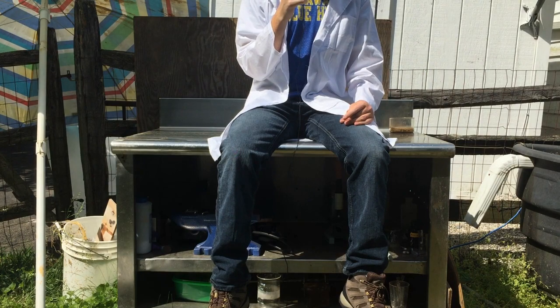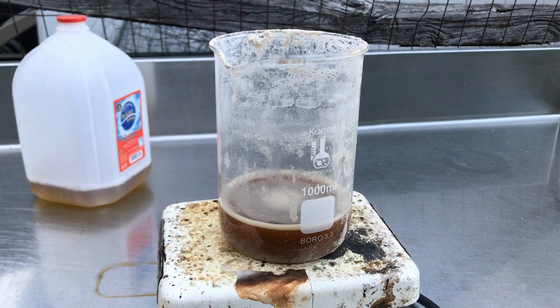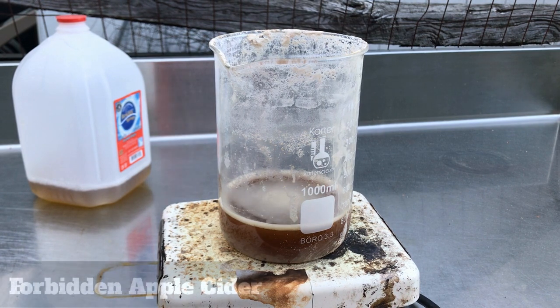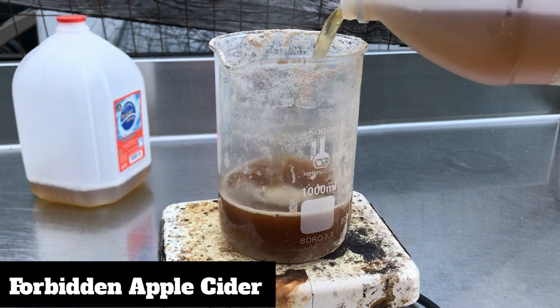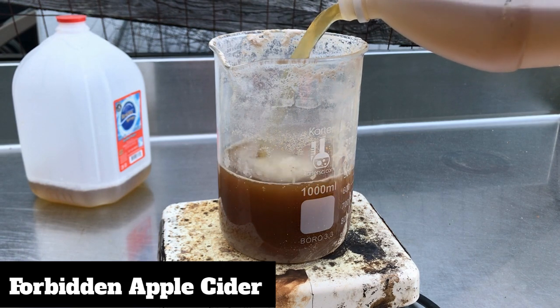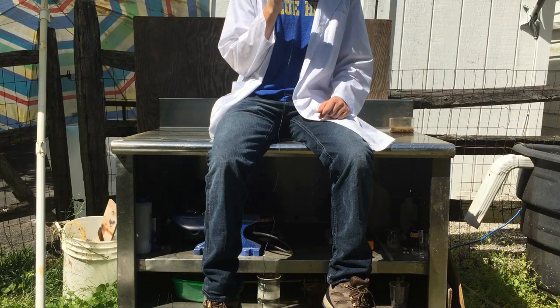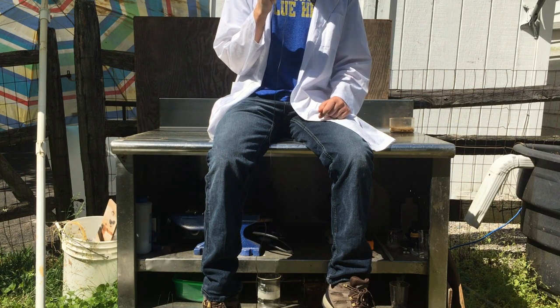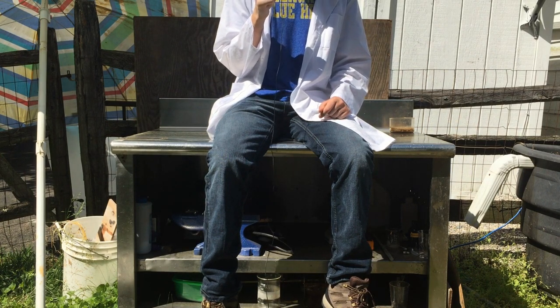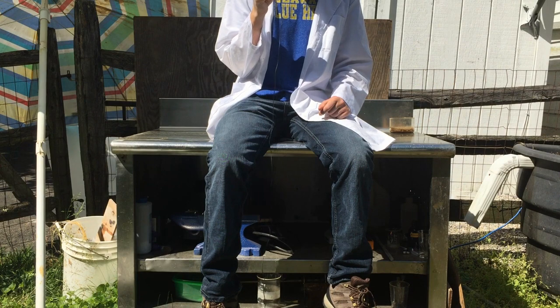I should note this is not the easiest way to make ammonia. You can produce ammonia gas from nearly any ammonium-containing salt. This synthesis is purely done out of curiosity as to whether it is actually possible to produce a concentrated ammonia solution from urine. And it's a really bad idea to do this in the first place, considering that boiling urine doesn't smell well and it really isn't going to be making any of your neighbors happy. This reaction made me gag on numerous occasions because concentrated pee smells a lot worse than regular pee. Do not try this unless you want your clothes and everything around your lab to smell like concentrated urine for days.